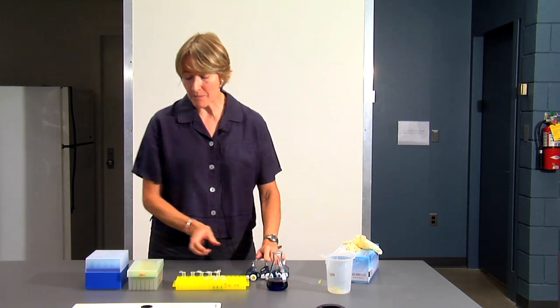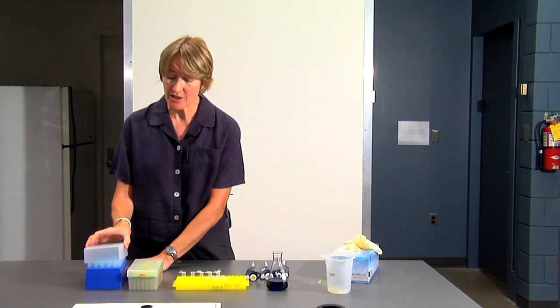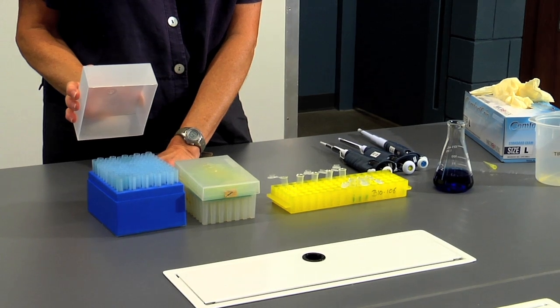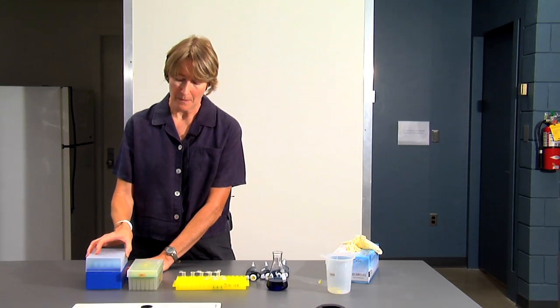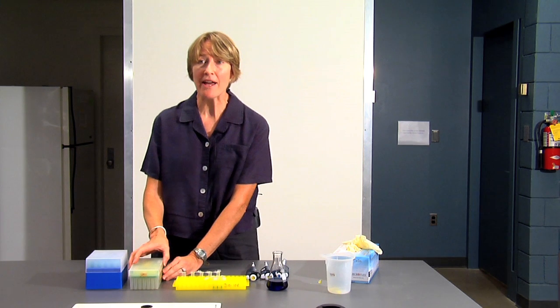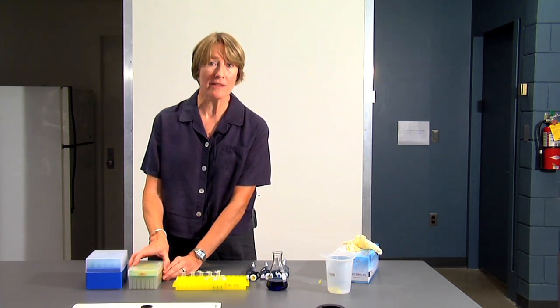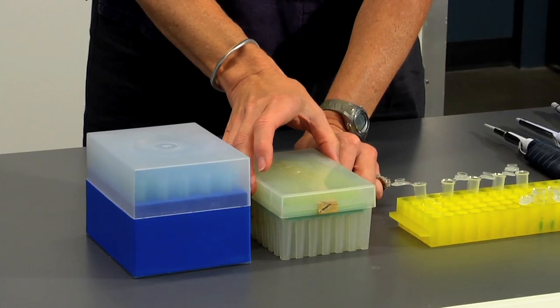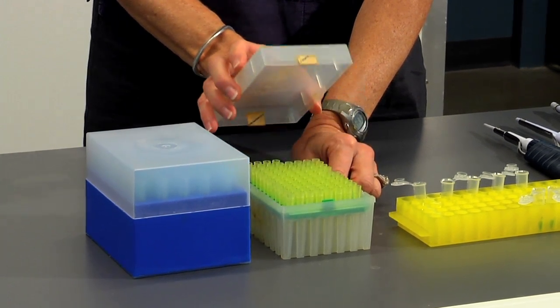If your micropipette has a blue dot, you use the larger blue tips. If your micropipette has a yellow dot on the top, you use the smaller yellow tips.